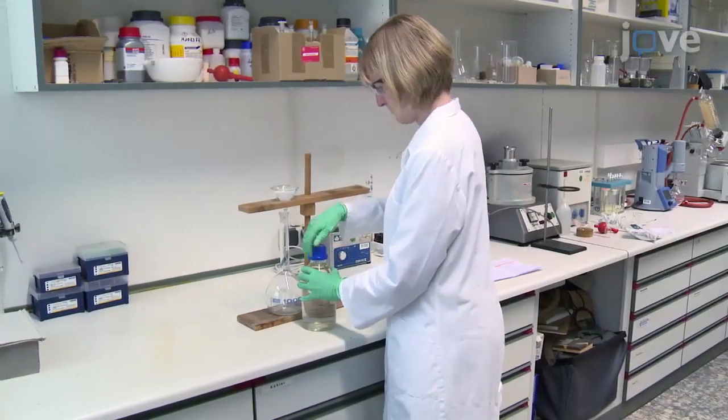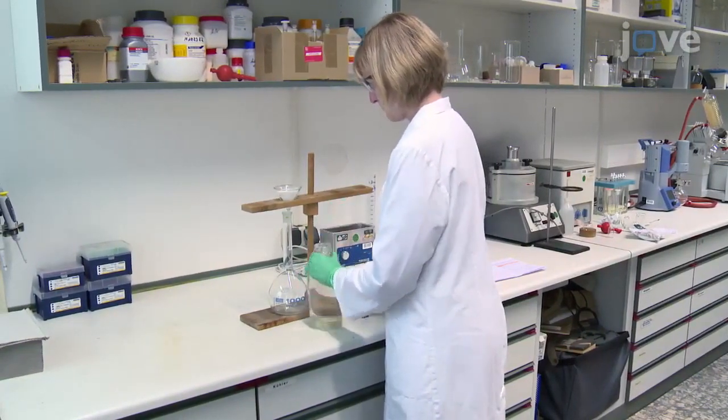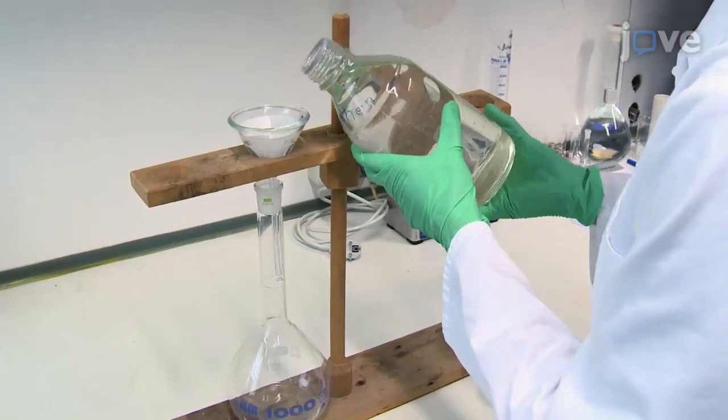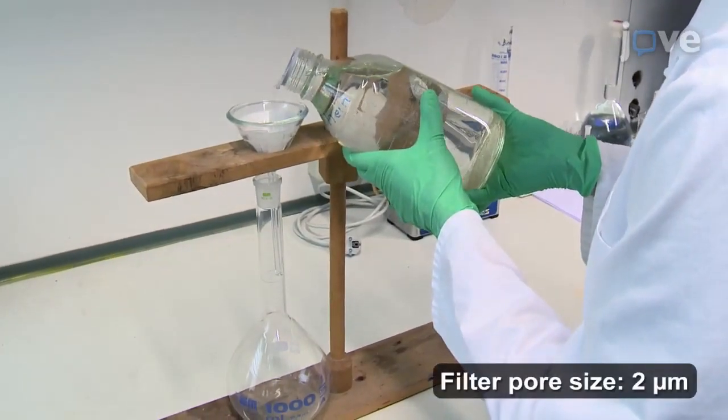To begin this procedure, collect approximately one liter of water to prepare the samples. Filter the sample over a blue band filter to remove coarse particles.